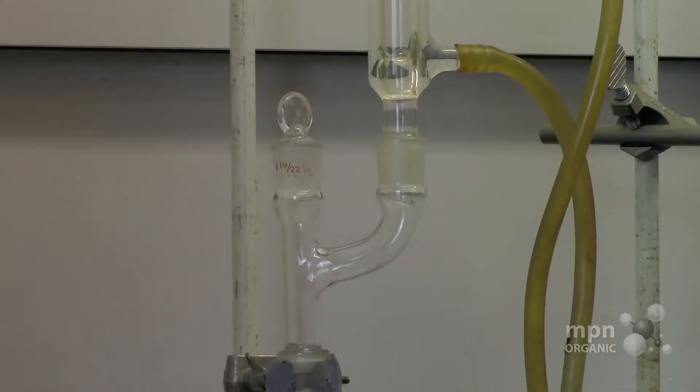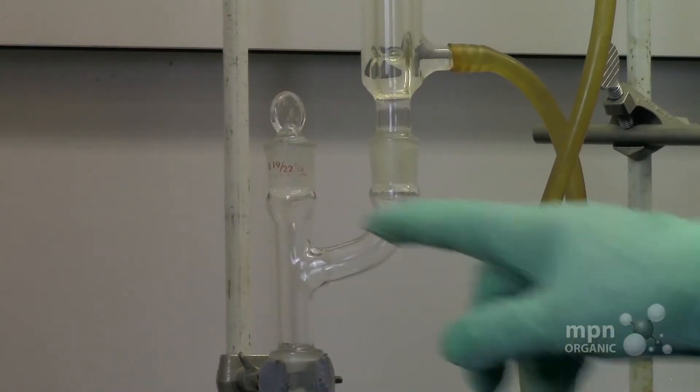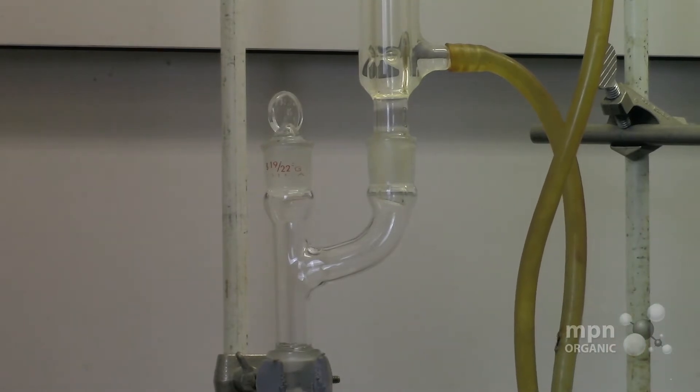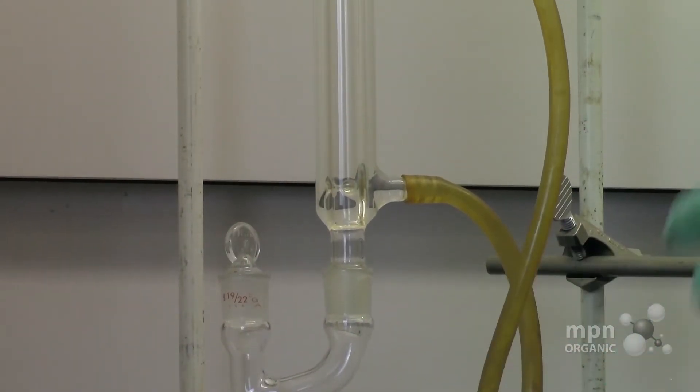Okay, and that's just another use of the Claisen adapter which you see here. So you can see how versatile this equipment is.